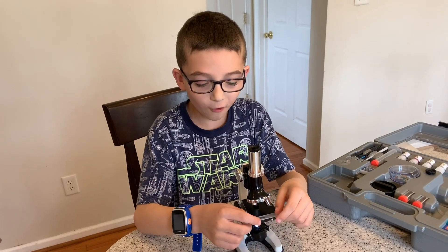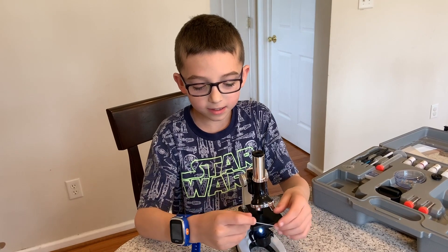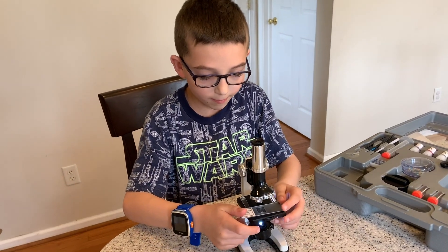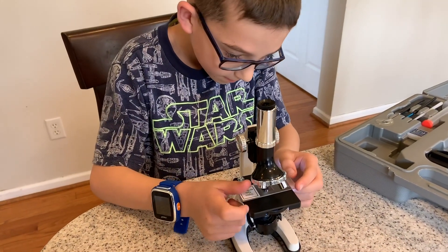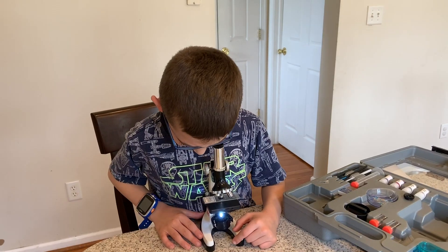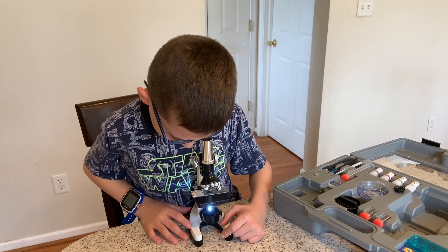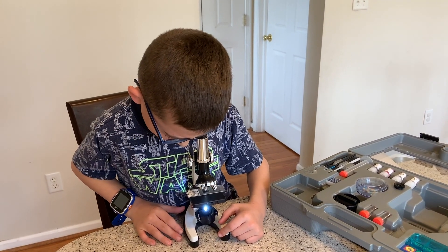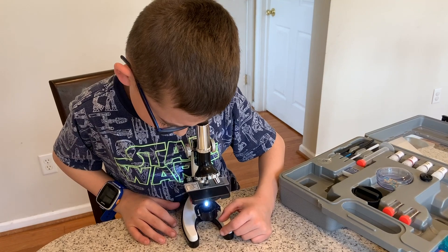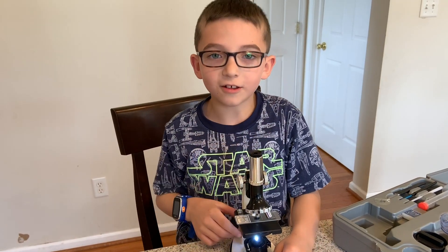Hi Spring Ford! Today, we're going to look at some onion cells, and let's look at it under the microscope. What do you see, Luke? You see an onion, but it has lines in it. Now you take a look.